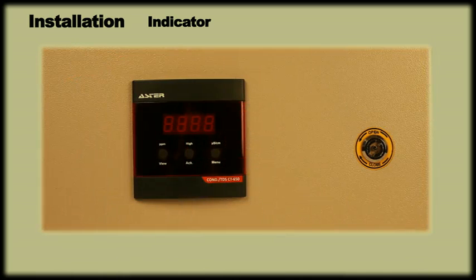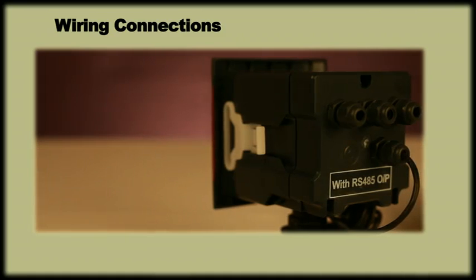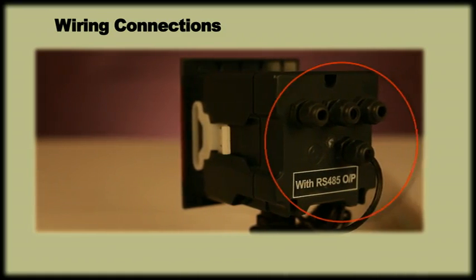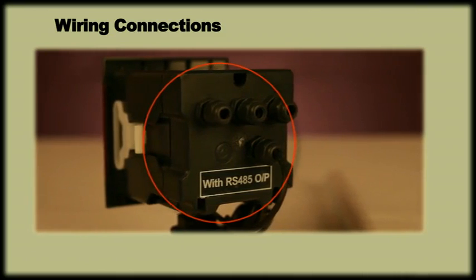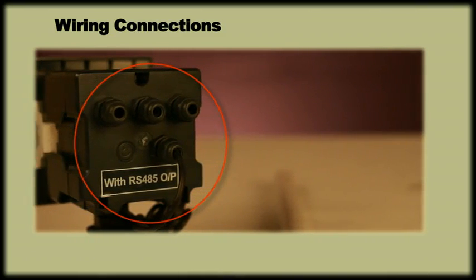Wiring connection. The meter has glands on the hinge cover to enroute the mains cable and output wires to their respective terminals.